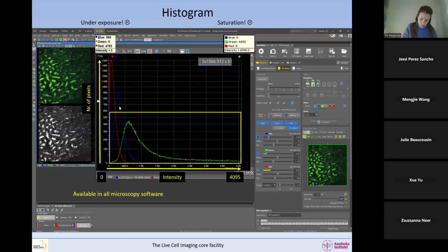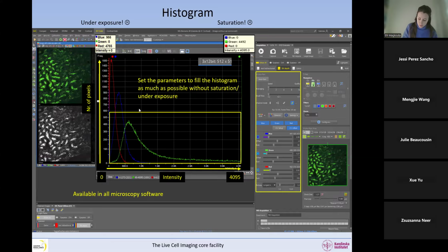We don't want to have our peaks very much to the left. And we don't want to have saturation and underexposure. And so we're going to set all our settings in such a way that we fill the histogram as much as possible, but we avoid saturation and underexposure. Okay, so we try to shift this peak to the right side, but still avoiding saturation and underexposure.